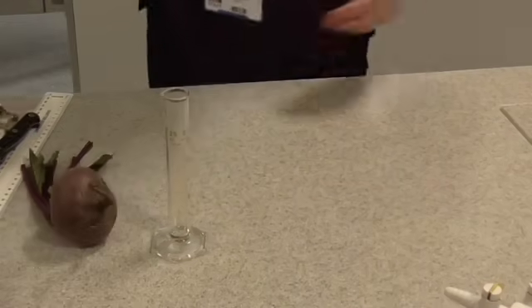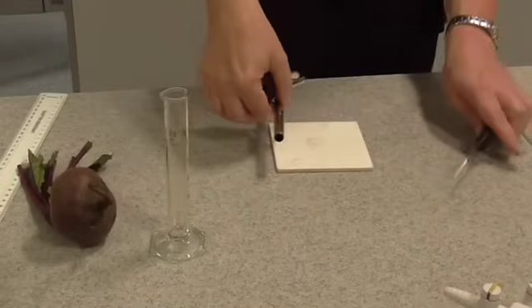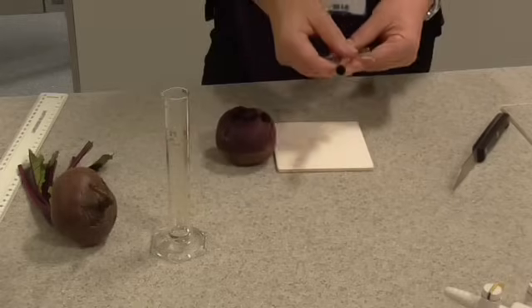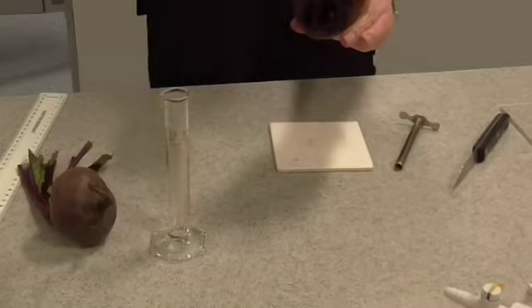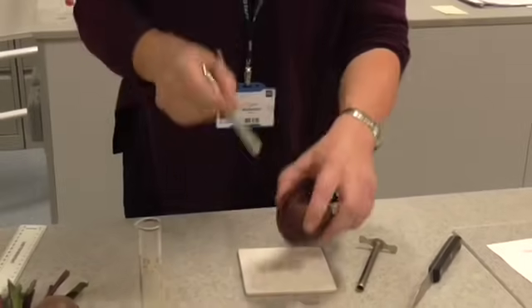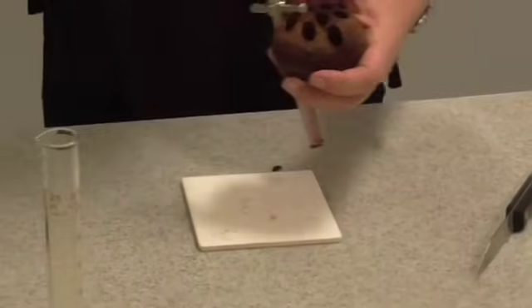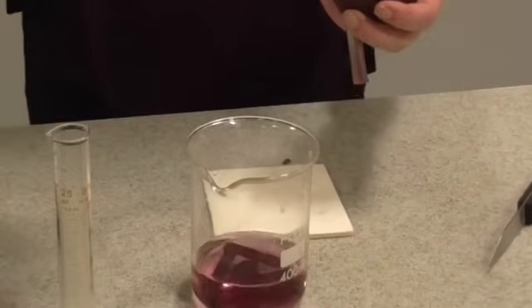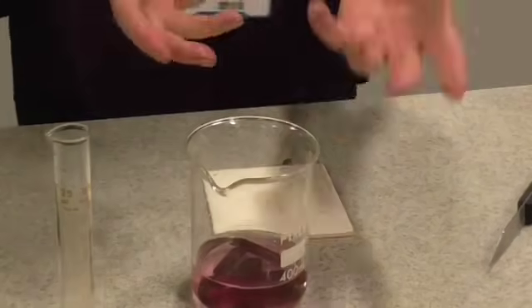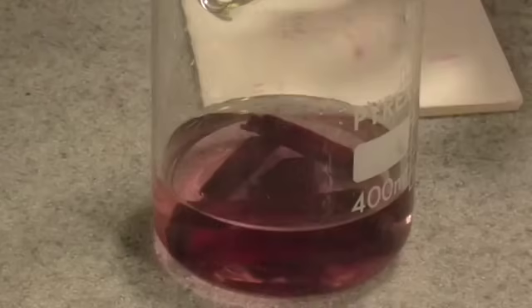Your next job is to use a cork borer — or you could use a chipper — to make yourself some evenly sized chips of beetroot tissue. A good way to do this is to use a cork borer and cut yourself some nice little cylinders of beetroot tissue. Give them a little rinse a few times in fresh tap water, just to remove any excess anthocyanin that's leaked out from the damaged cells.